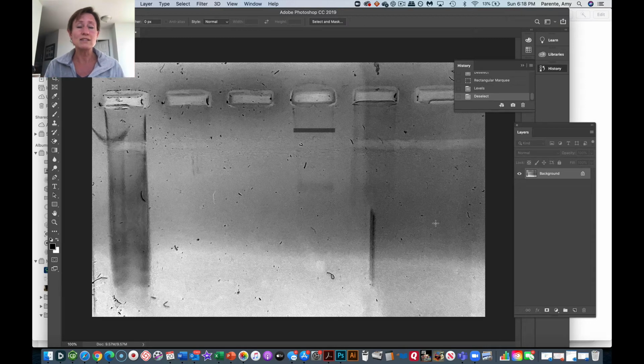I can show you guys. It was a paper that students found last year in my research group. It literally looked like this. It was so ridiculous. But you can have people who work a little bit more effectively with Photoshop editing to change the intensity of their bands. We don't want to do that. Okay, so here's where we were.